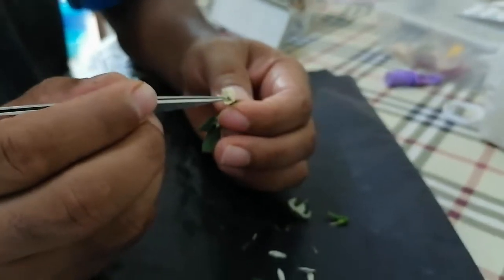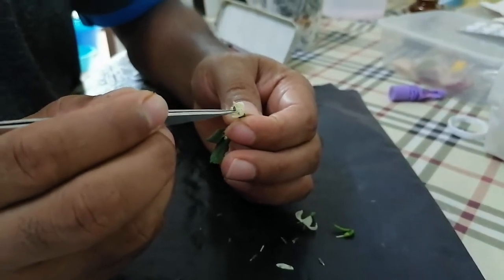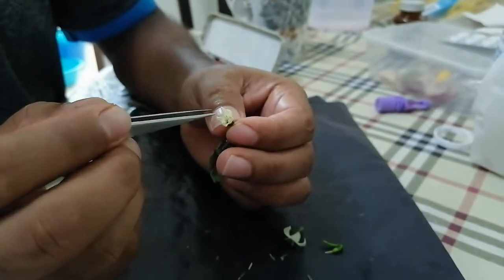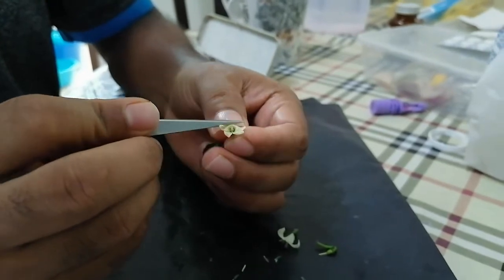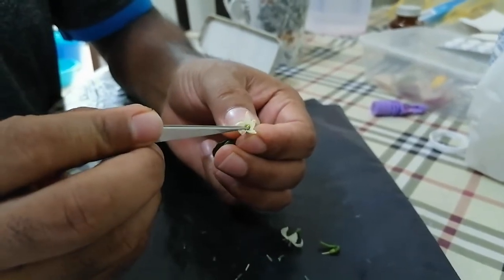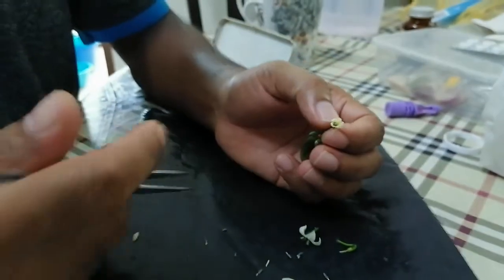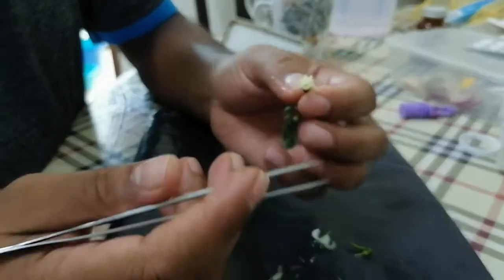If you hurt the stigma, your target will be missed. I have removed all the anthers, and in the middle you can see the whitish stigma remaining. After that, you have to bag the flower again using special types of bags for hybridization.